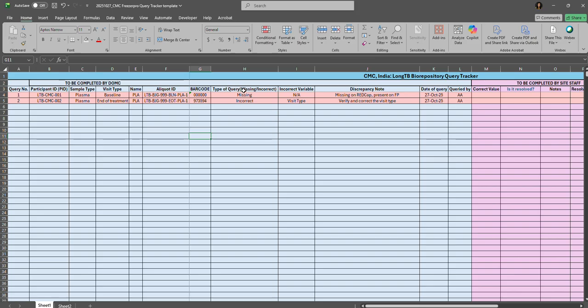And the field type of query indicates two categories, either missing or incorrect. Missing queries are when a sample or aliquot is not found in either the sample report, repository report, or on the REDCap. An incorrect type of query is when there are discrepant values found in a sample report, like incorrect PID format or incorrect volume for the sample type or other data discrepancies. For the incorrect type of query, an incorrect variable will be indicated in the incorrect variable column here.